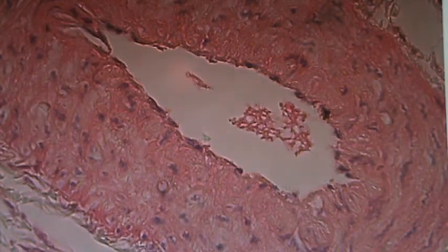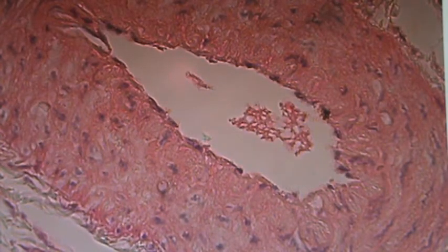Now what we have here is an artery, and it's a small one, but notice real quickly some things about it. First of all, on the inside here, these little red things are erythrocytes, and that is connective tissue, so the major tissue type is connective, and the specific type is blood.